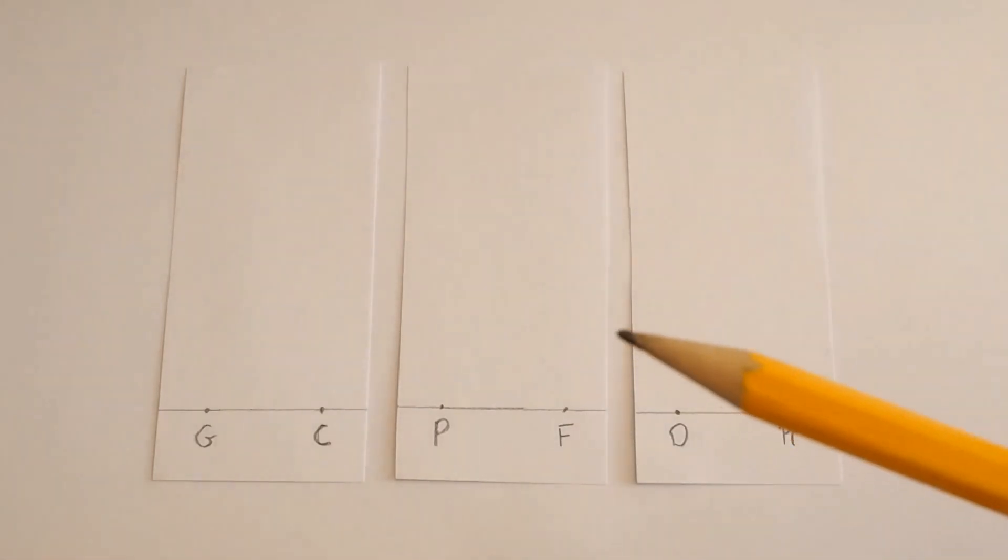Now the reason I'm using pencil is because pencil won't move with the solvent. If I put a pen on here, some ink, when I put it in the liquid the ink would move as well as all the molecules. That wouldn't be any good now would it?